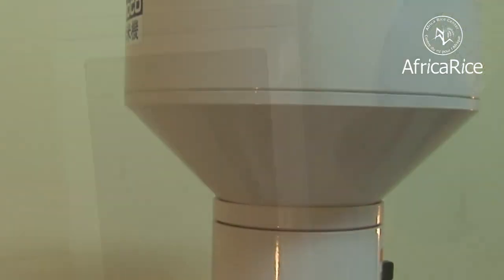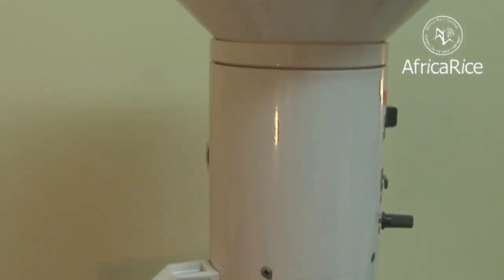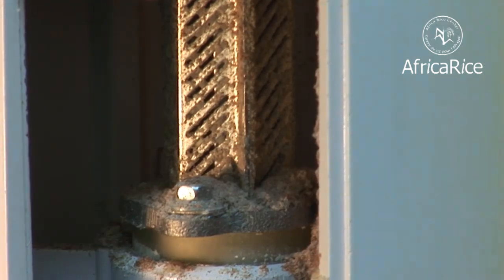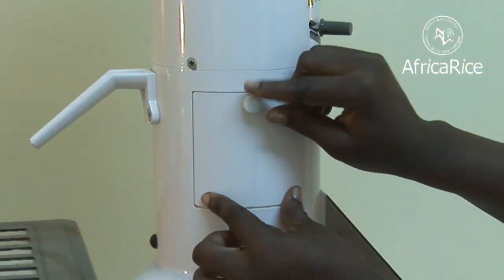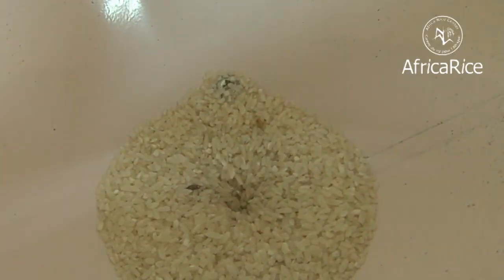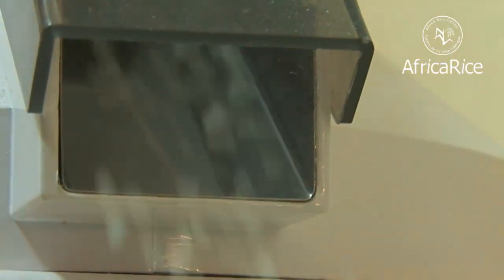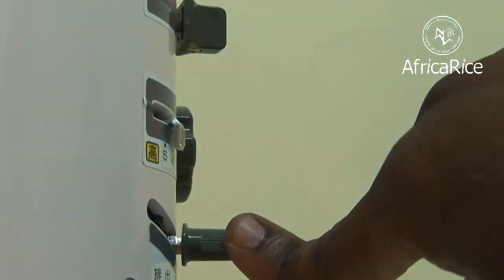The dehusked grains are then passed through a lab whitener or polisher that removes the bran as a result of friction among the grains and between the grains and the inner steel screen. The milled grains are collected in the front of the whitener, while the bran is collected in a receiver behind the equipment.